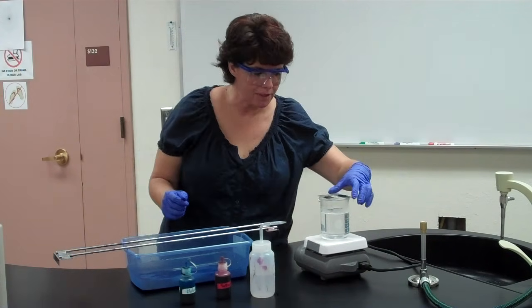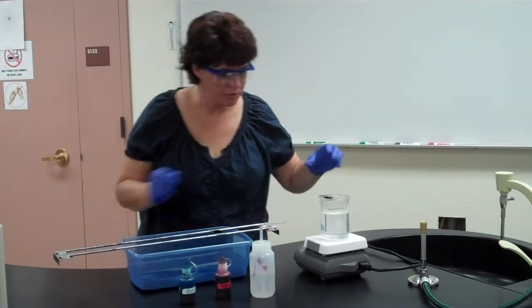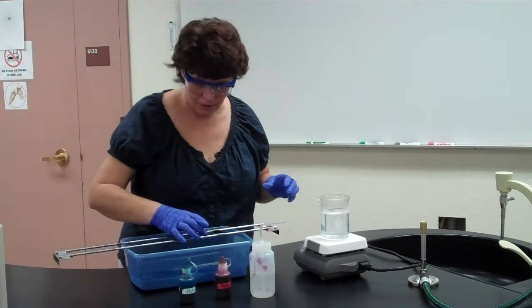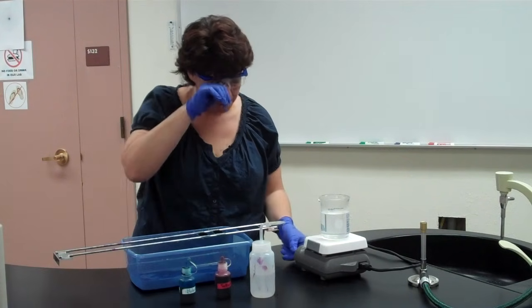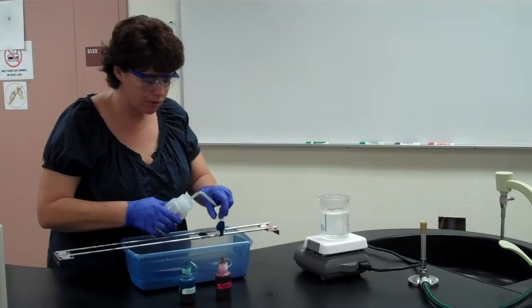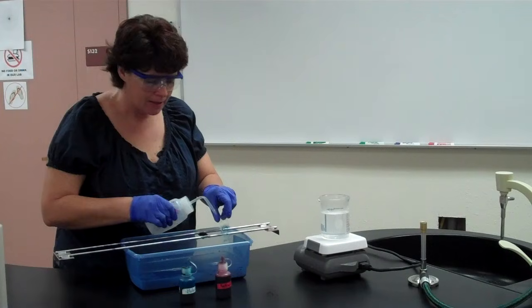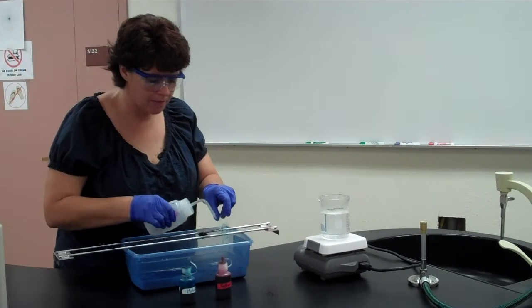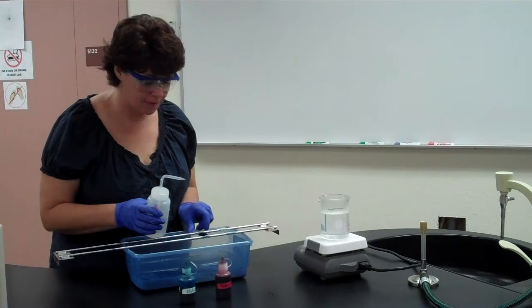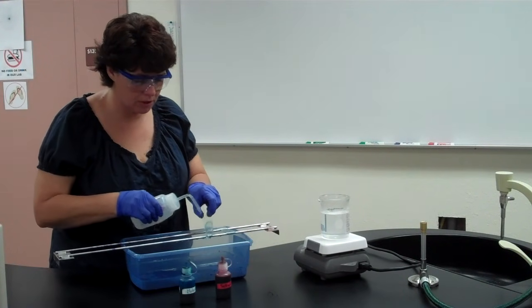So after our 5 minutes, we're going to gently take them off. Once again, you'll note I can just grab them with my fingers if you have the right size beaker, and the water's not that hot, okay? Turn that off because I don't need it anymore. We're going to rinse with the water as we've done before. Now, if your slides get extremely hot, that probably means that your water was too high, but if they do, don't rinse them right away because they're going to crack, okay? Mine weren't too hot. If they're cool to the touch, you're good to go.